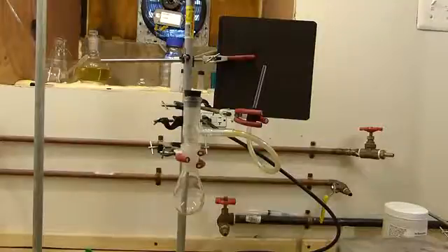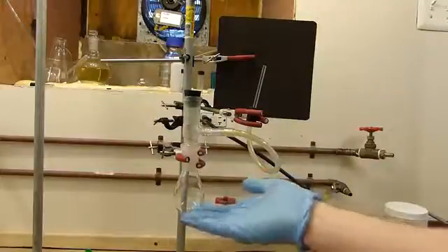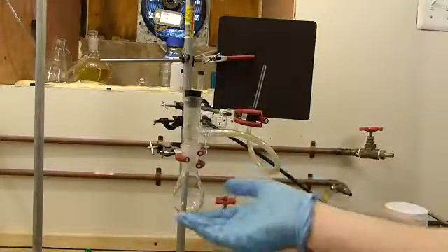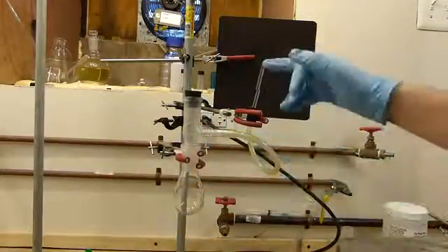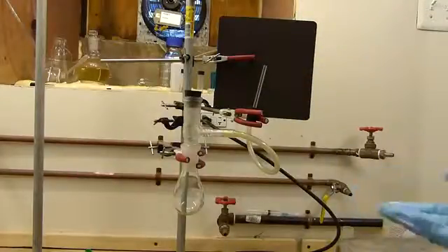So I've set up a demonstration carbon monoxide generator, which consists simply of a flask where you can place the concentrated formic and sulfuric acids and then heat them gently, which will evolve the carbon monoxide gas. In this case the carbon monoxide will just escape this tube, whereupon I'll burn it at the end of this glass tube to show the flammable properties of carbon monoxide.